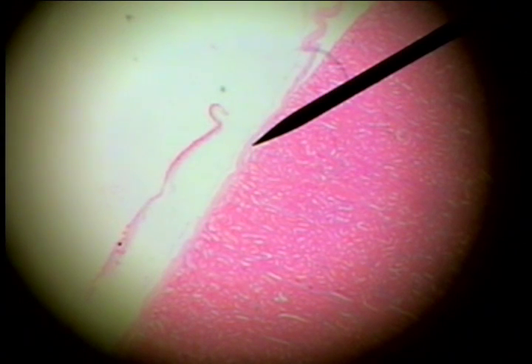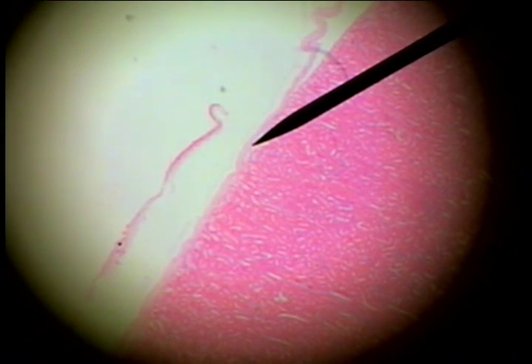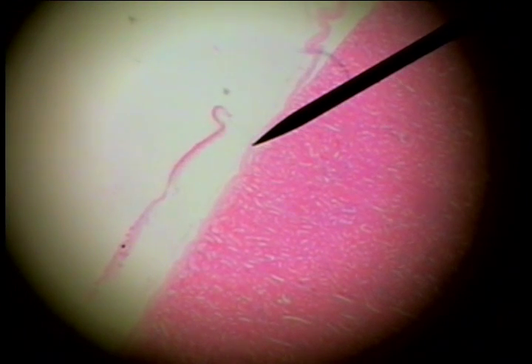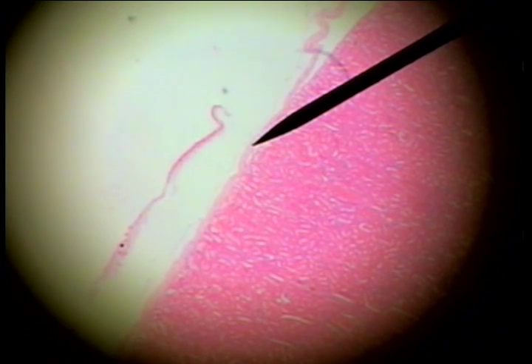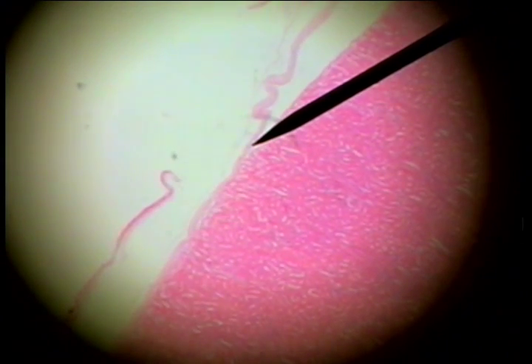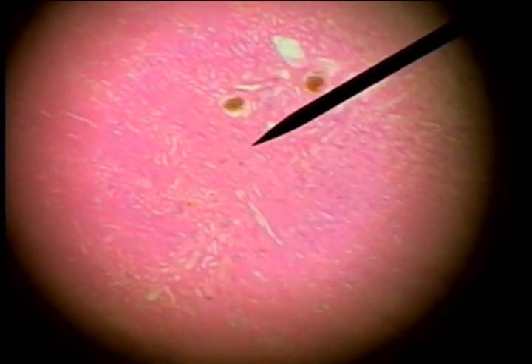The major organ of the urinary system is the kidney. There's an outer connective tissue capsule on the surface of the kidney, and you can see the capsule pulled away here. As we scan in to this denser outer surface, this is the cortex of the kidney.